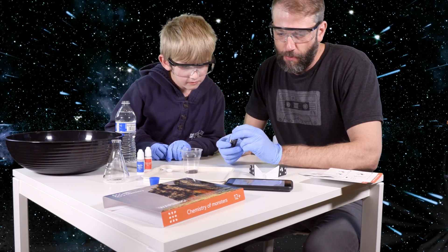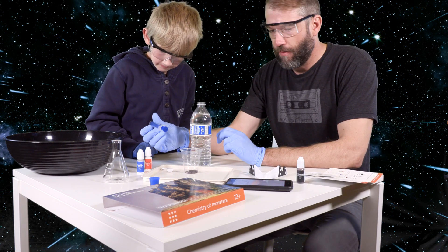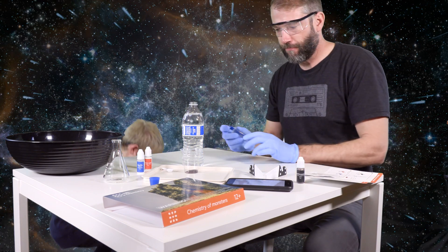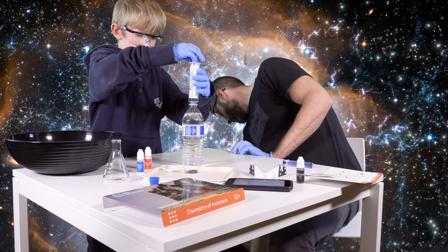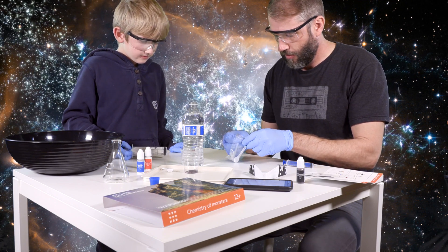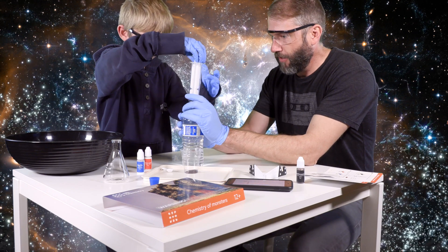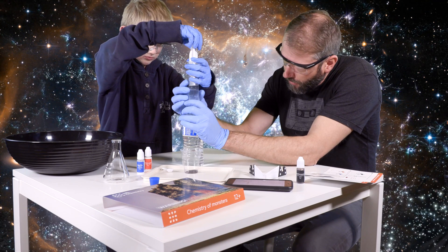Transfer 20 milliliters of water into the plastic cup using the syringe. Is it all of it? Well, this one is 10 milliliters - so use the other one. There are two syringes. Will that syringe fit into the cup? 20 milliliters. That syringe will not fit, hold on. So this kit comes with this little tube - a little piece of tubing. Go ahead and watch what you're doing. There you go. A little bit more. Yeah, that's probably good.